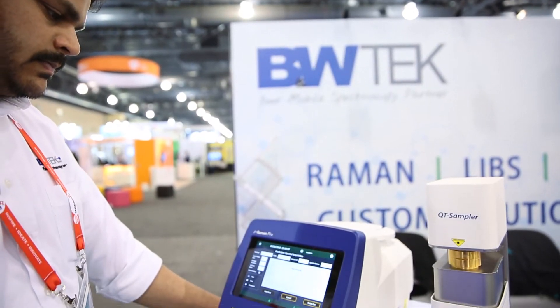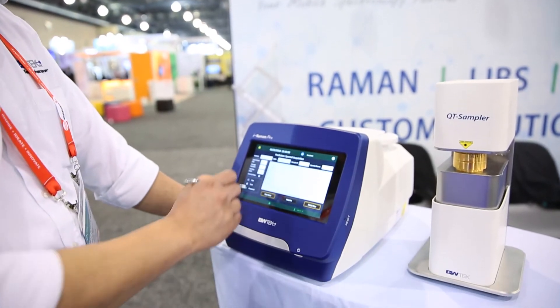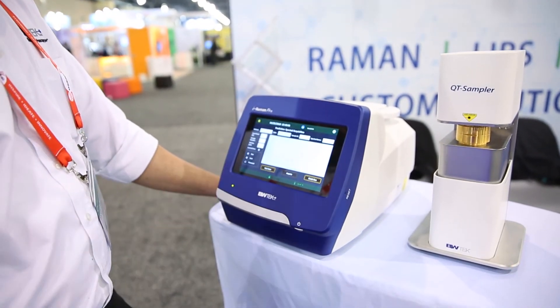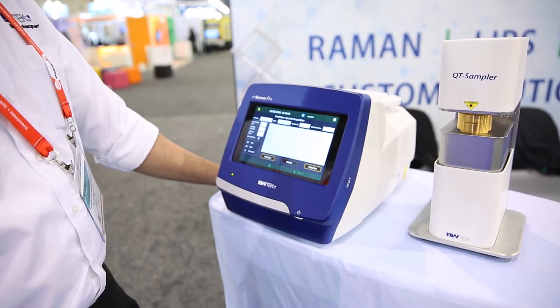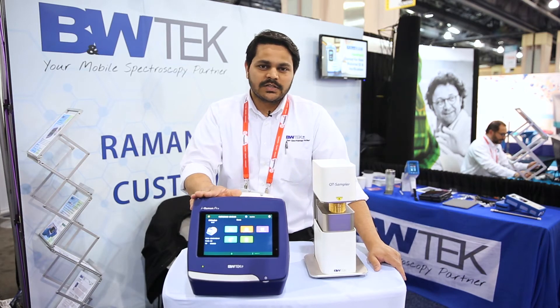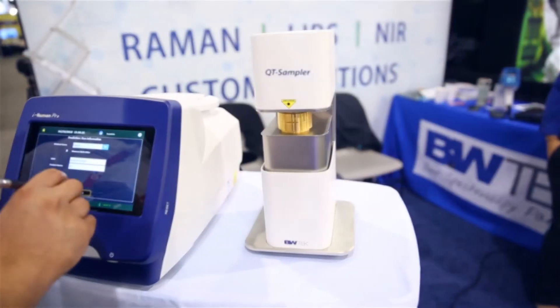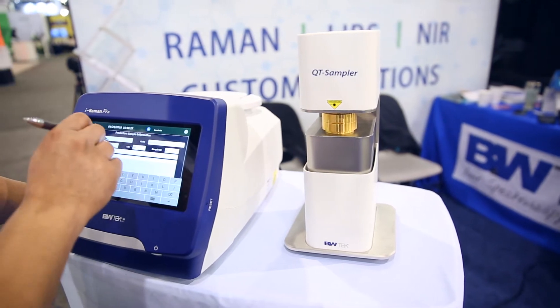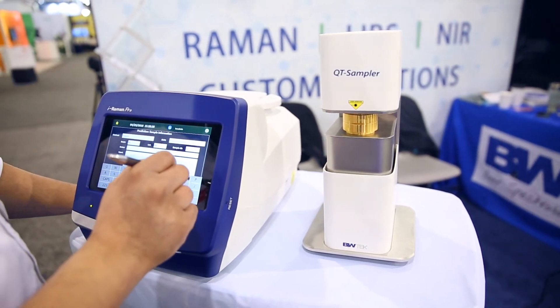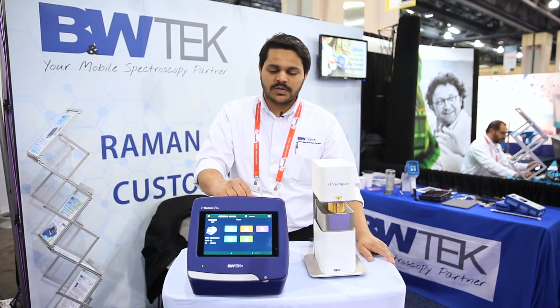The software we have here is our all-new BW Analyst. It is completely 21 CFR Part 11 compliant and has various different features. It allows developers to build quantitative methods or models, guiding them through the model building stages of collecting spectra, exporting them, validating the spectra, and then releasing those models.